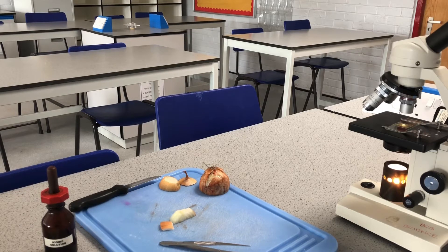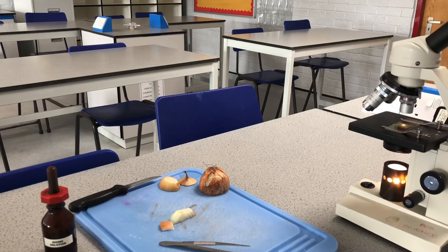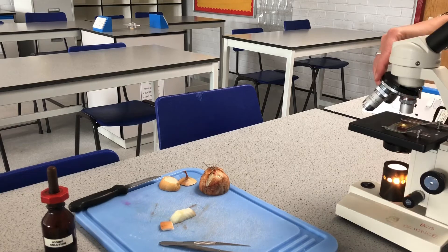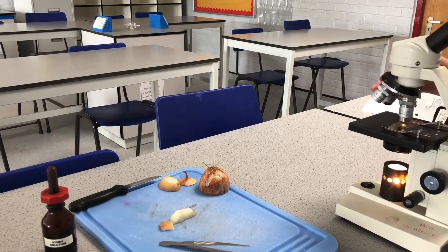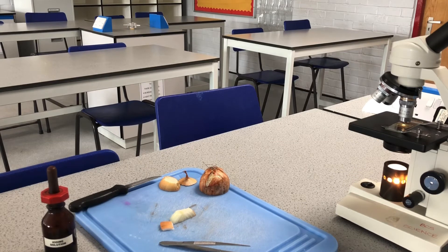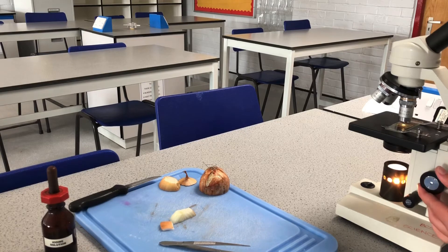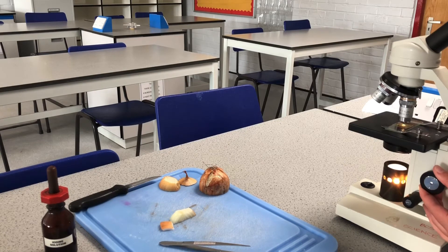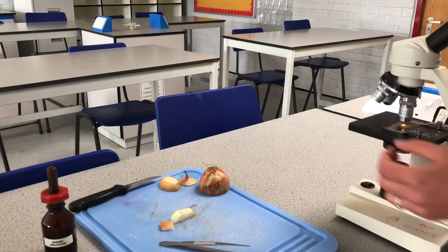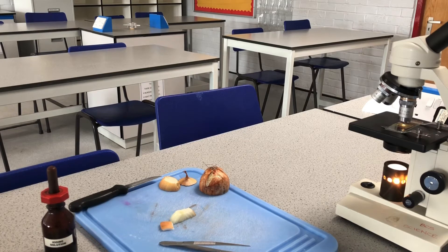It's really tempting when we draw these to just draw some grid lines like a giant noughts and crosses, but that's not really what it looks like — you've got to draw what you see. Focus on a few cells and draw exactly what you see. Once it's in focus we can use the fine adjustment, then go on to medium magnification, and possibly on to high power as well.